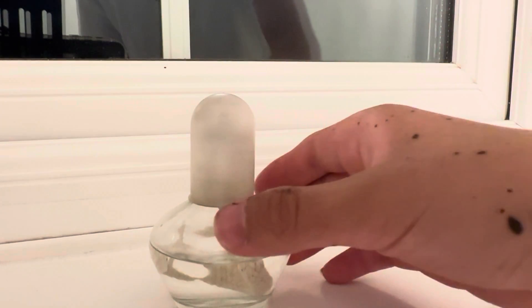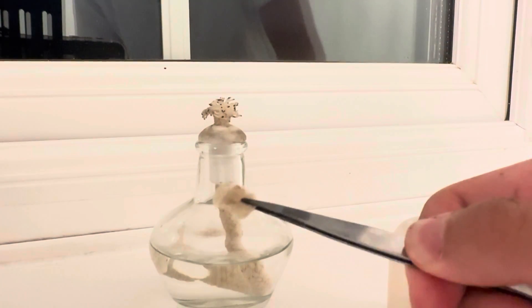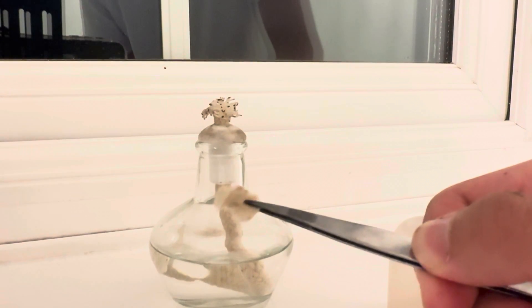However, we can make methanol burn spontaneously in air by using platinized asbestos, which is asbestos soaked in hexachloroplatinic acid in ethanol or methanol solution.